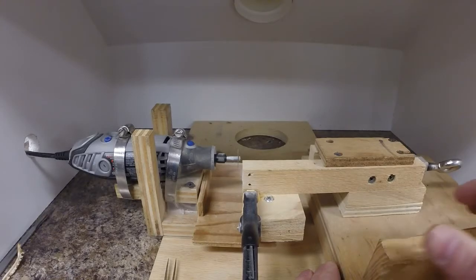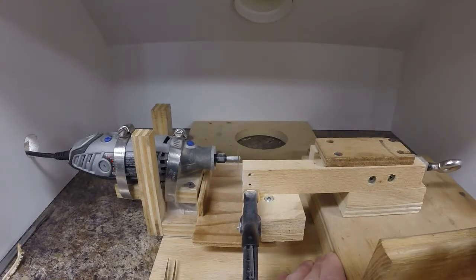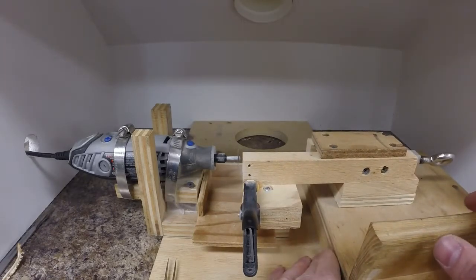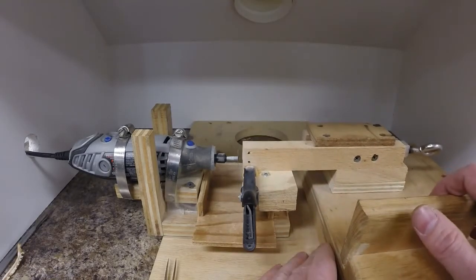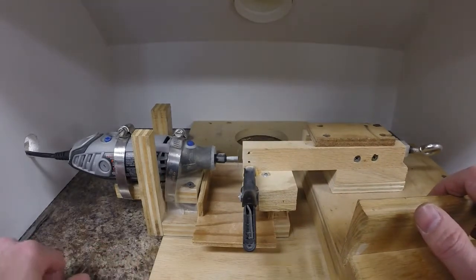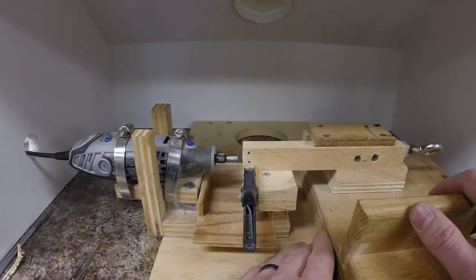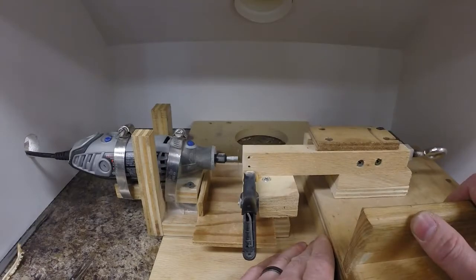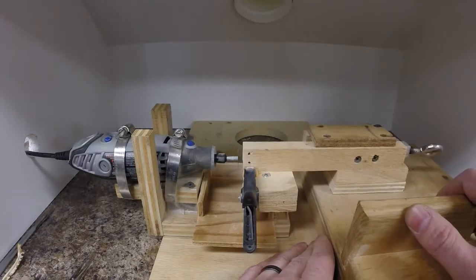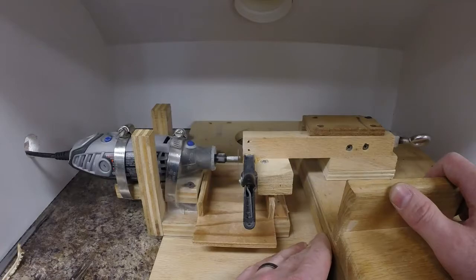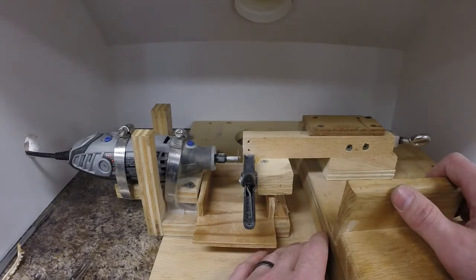When I run them through on my setup, there is a little bit of play side to side, so I usually just push it sort of away from the saw and just run through really slowly. The slower you go, the less likely it is to shoot the sections off into nowhere. Sometimes that still happens. If it does, I just take another one. But most of the time, if you just run it through really slow and try to stop right at the end, the sections drop down in the tray.